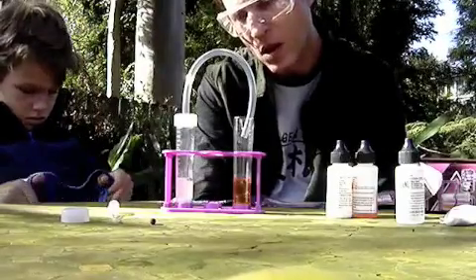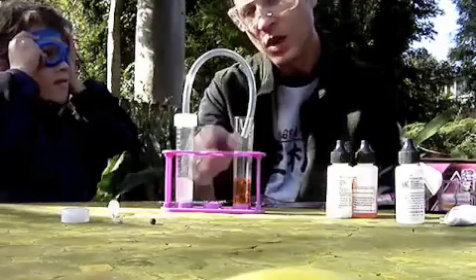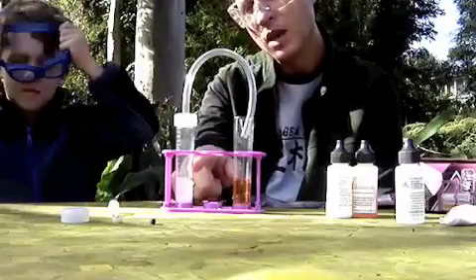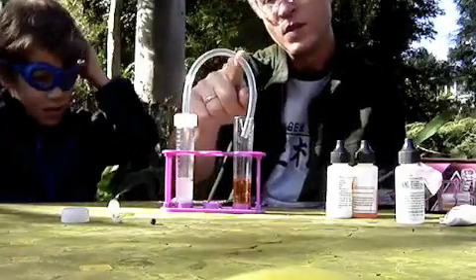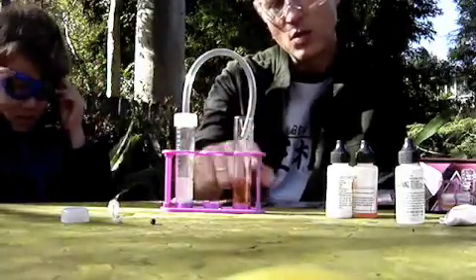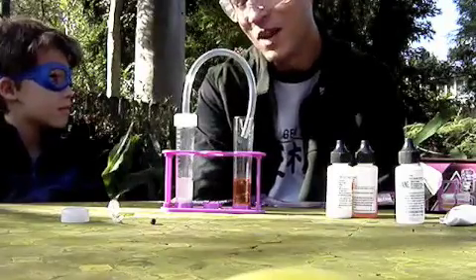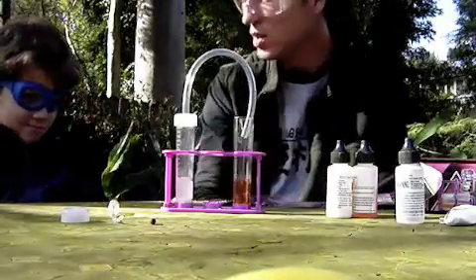The citric acid is reacting with the marble and creating carbon dioxide gas. The carbon dioxide gas bubbles are flowing to the surface, and then the gas is flowing up through this tube, down into this tube. This is a chemical which changes color when carbon dioxide gas goes through it — so this will change from red to yellow.